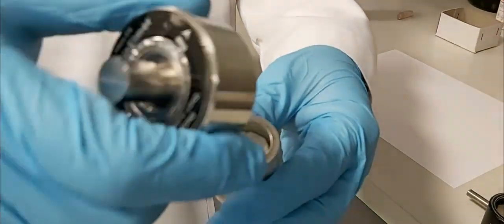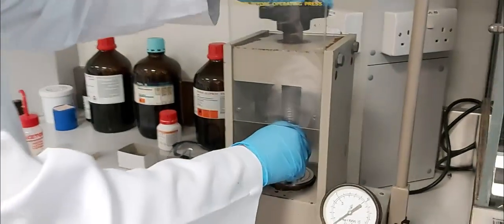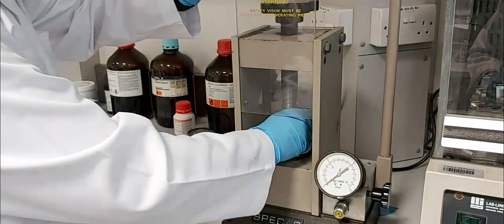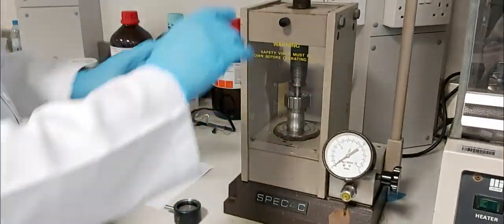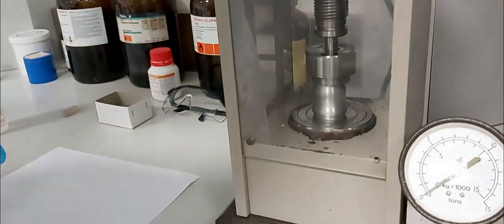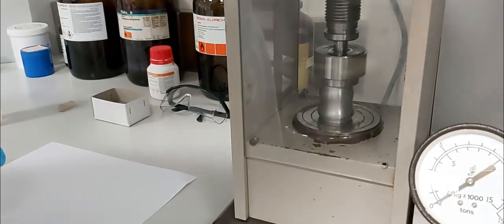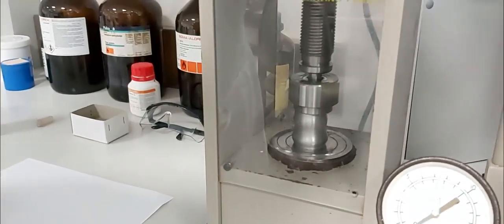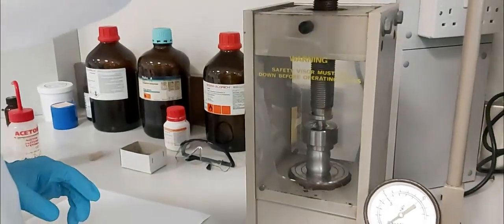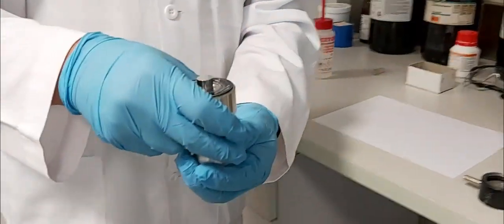Removing the disk can be difficult. We use the hydraulic press setup, but here it is enough to apply only a small pressure by hand, as you can see. This is the method to remove the small disk or pellet formed. You will see the disk now.